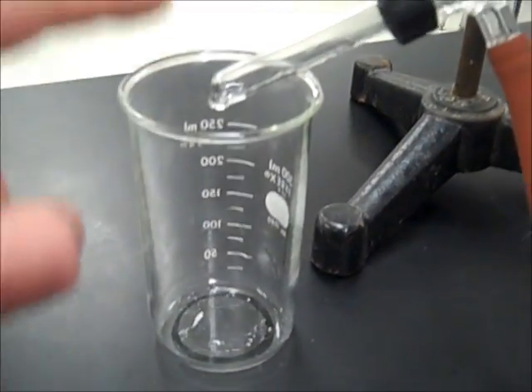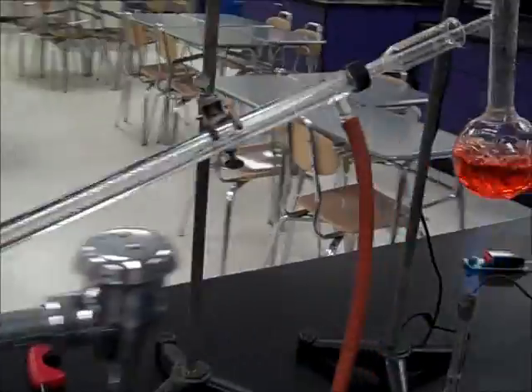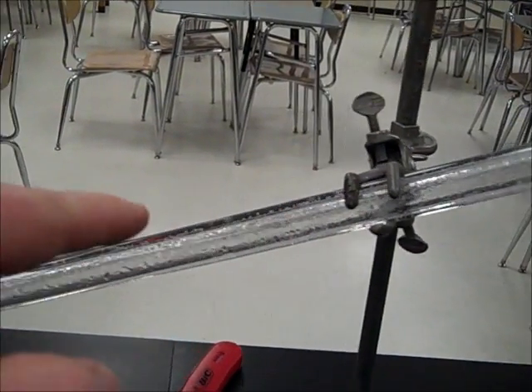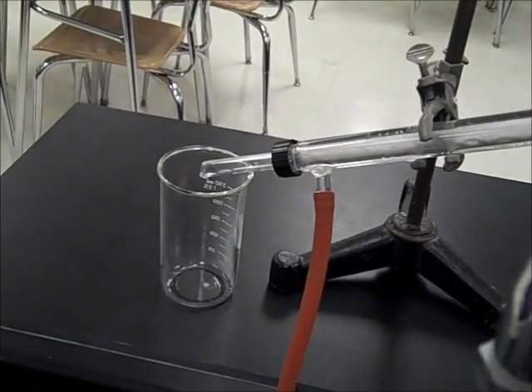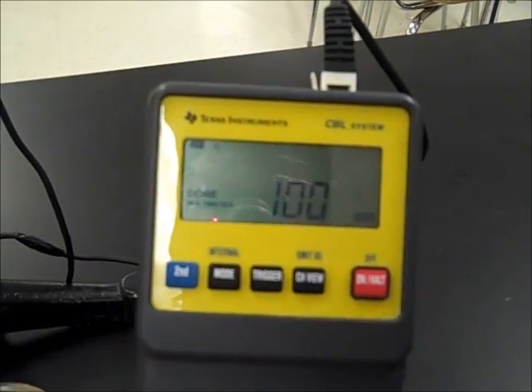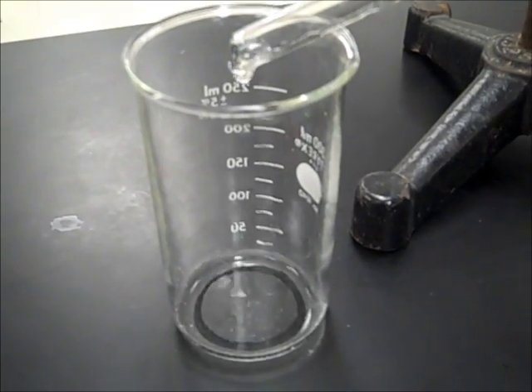The exciting thing is what's happening on the other end of the condensation tube. We can see drop by drop water — the water droplets that are collecting here in this beaker are the result of condensation of vapors formed here, which are passing through this tubing coming into contact with cold, colder, and coldest glass. The cold surfaces are causing the water vapor to condense to form liquid water which we're collecting in the beaker right down here. We can see that we have a nice boil going inside of our distillation flask. The temperature is reading right now 100 degrees — the boiling point of water. Here we can see the contents of our collection beaker; we can see it's drops of purified water, definitely not seeing any of the red food coloring passing through here.